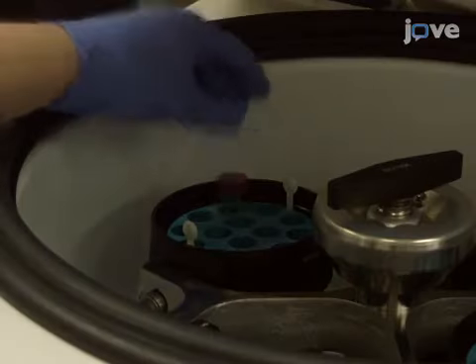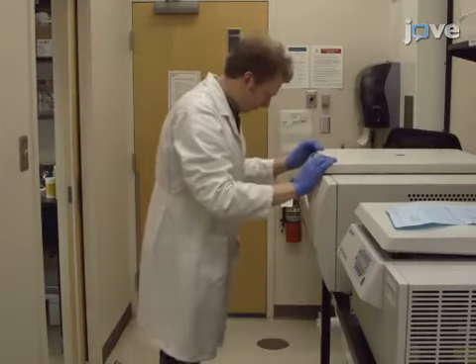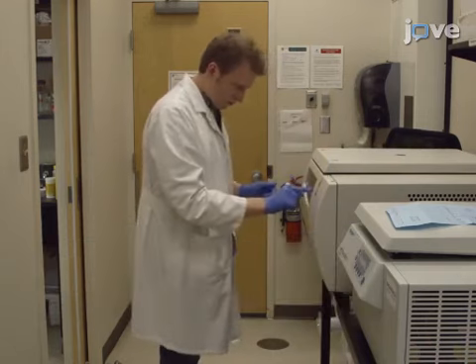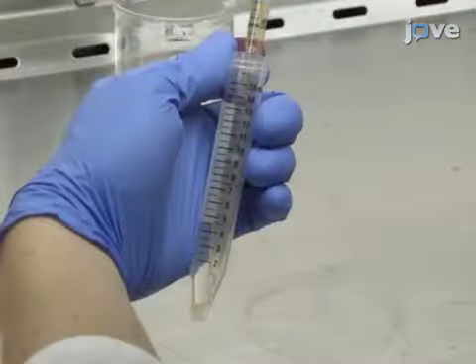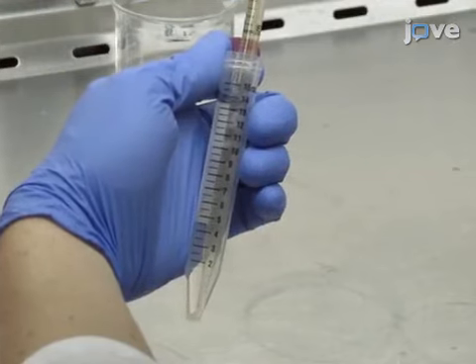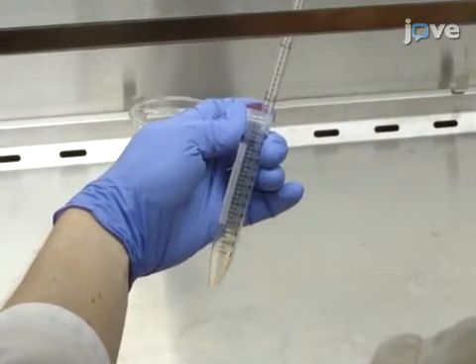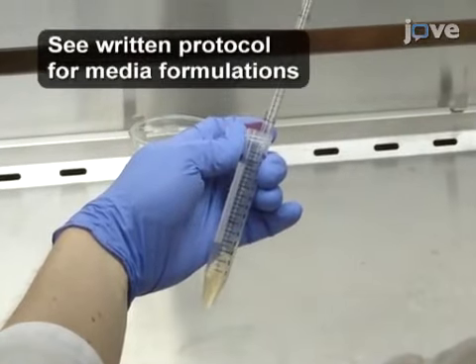First, centrifuge a single-cell human pluripotent stem cell, or hPSC, suspension at 200 times G for 5 minutes. Following the centrifugation, aspirate the wash medium and resuspend the cells in aggregation medium at a density of 1.2 times 10 to the 6th cells per milliliter.